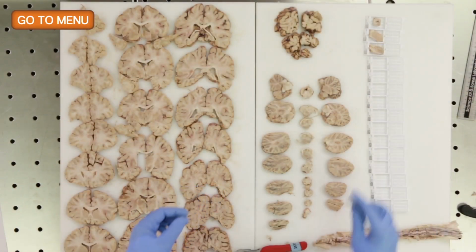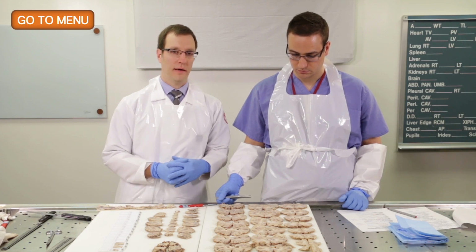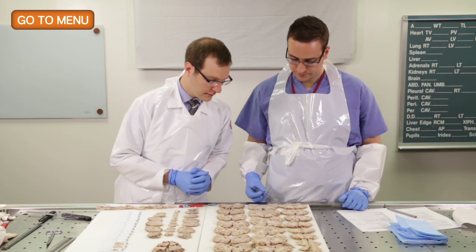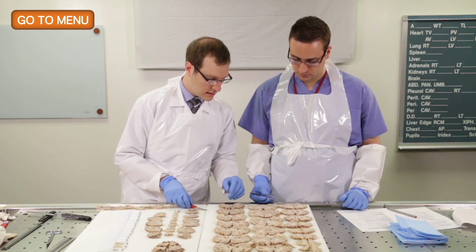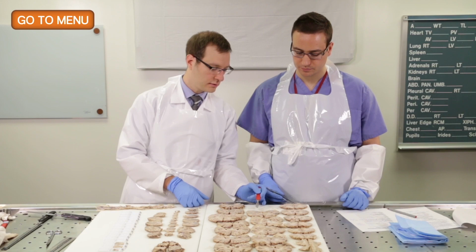Okay, so the fourth section that we'll sample routinely is the hippocampus, and we'll select an area near the lateral geniculate nucleus for purposes of standardization across cases. So in this case, we can see the lateral geniculate nucleus right here. So this is a good cut of the hippocampus. You want to make sure that you retain the entire entorhinal cortex. So really, you should keep all of the medial structures and go as laterally as possible, and retain the lateral geniculate as well.